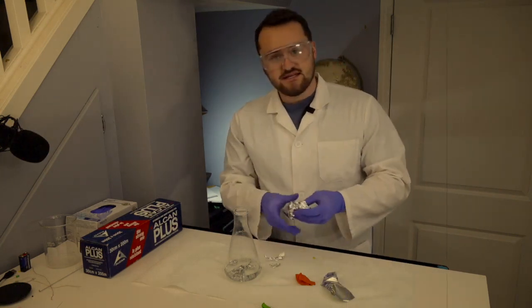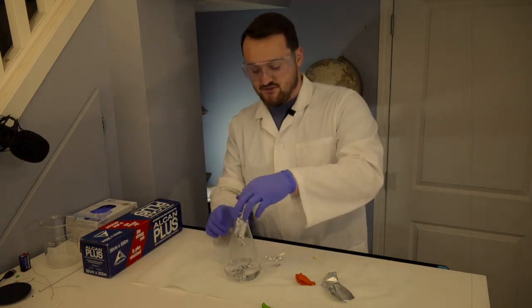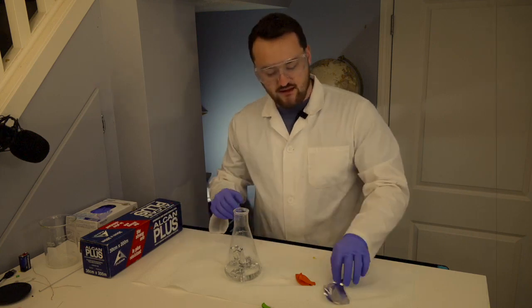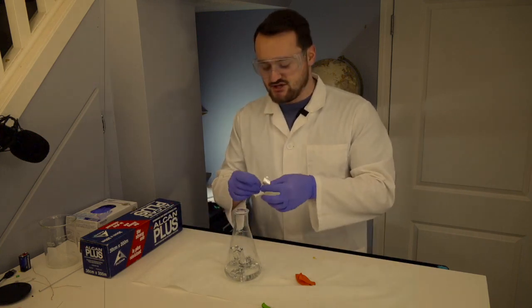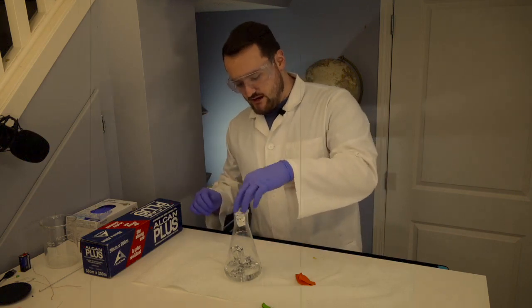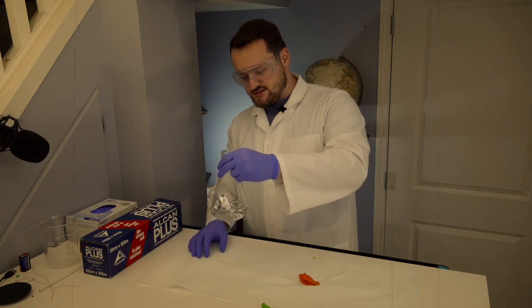Now, the reaction that makes the hydrogen is not a synthesis reaction. It's a different kind of reaction. It's a single displacement reaction, and I'll explain more about that in a minute here. For now, we have aluminum and hydrochloric acid.